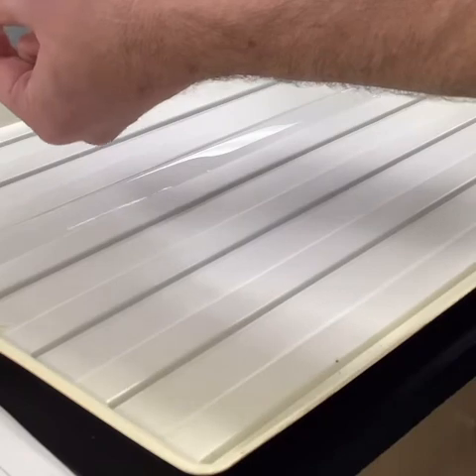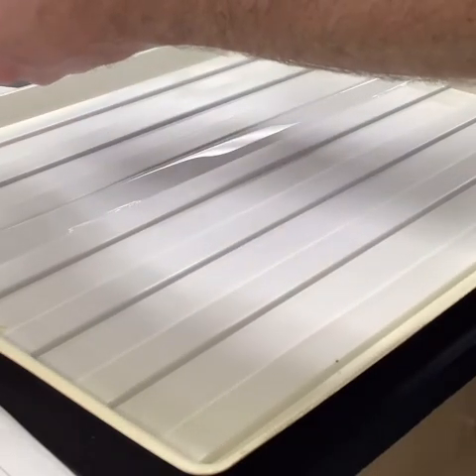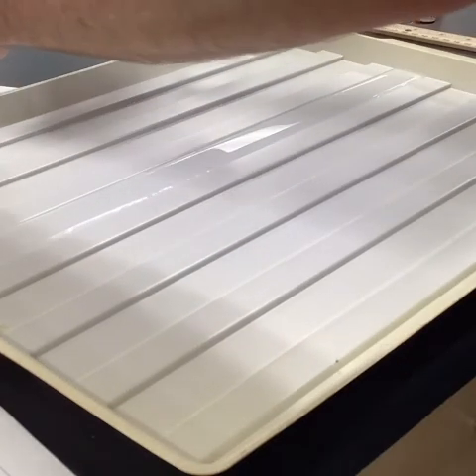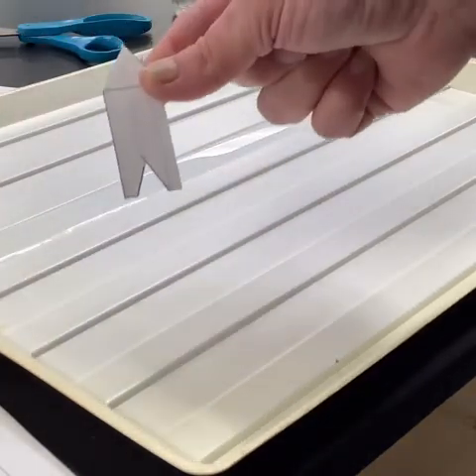And then we just need to get this notch out right here. It didn't photocopy well, but that's supposed to come out. Okay, so we've got something that looks like this.